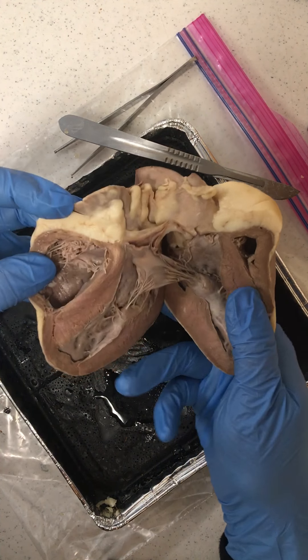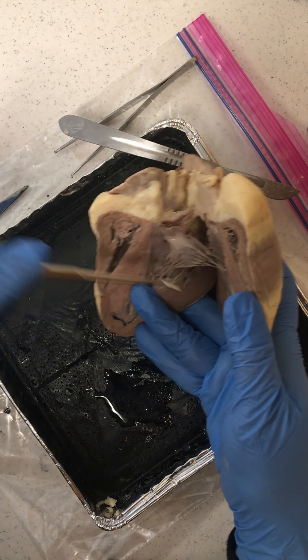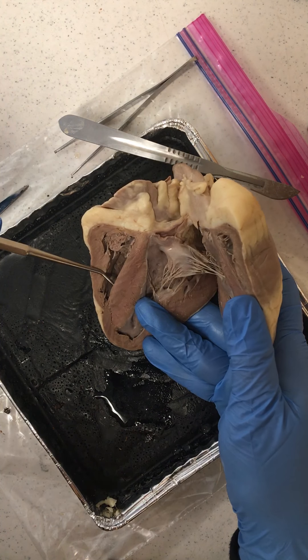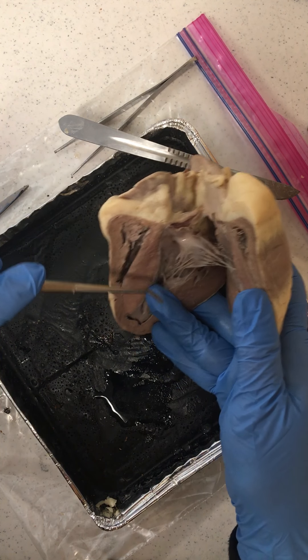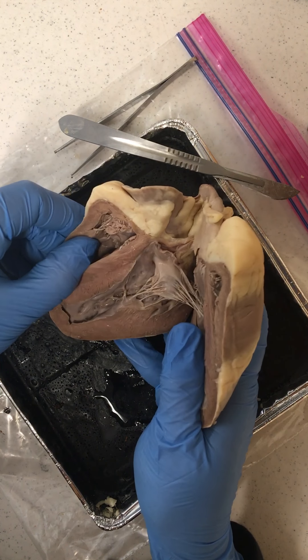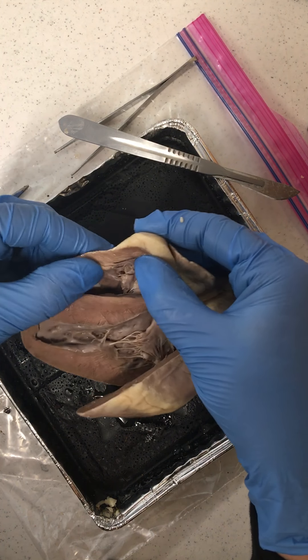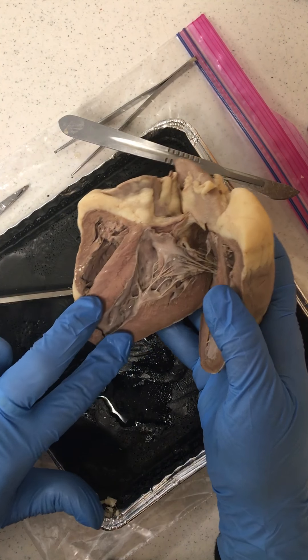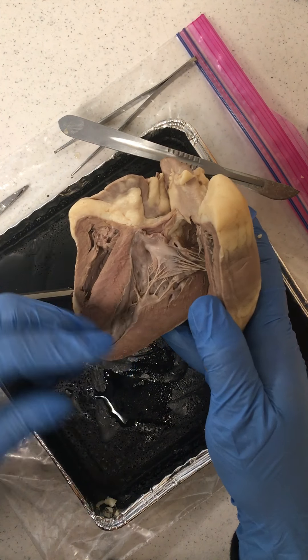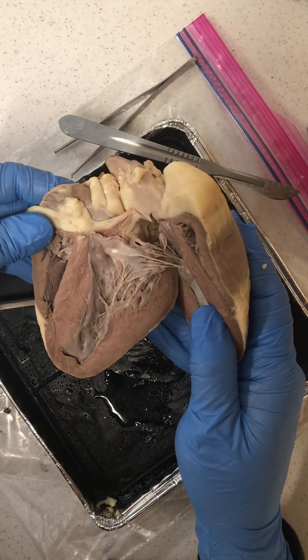As we dissect the heart, we can see the different muscle thickness in the different ventricles. We have our right atria and right ventricle here, and our left atria and left ventricle here. Notable is the thickness of that myocardium, that heart muscle. On the right side it's more malleable, not as thick, but on the left side you can see just how thick that myocardium is — that's because that's where the main work is done, with a lot of forceful contractions happening in the left ventricle to force blood out through the system.